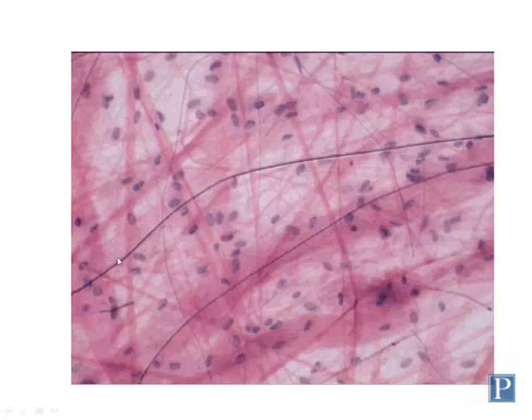Additionally, you can see some other thinner fibers that stain more basophilic, giving it a kind of bluish black color. These fibers are thinner, and there aren't as many of them. These are called elastic fibers. So you can see several elastic fibers in the slide. There's one here, here's another one, here's one, here's another one here.